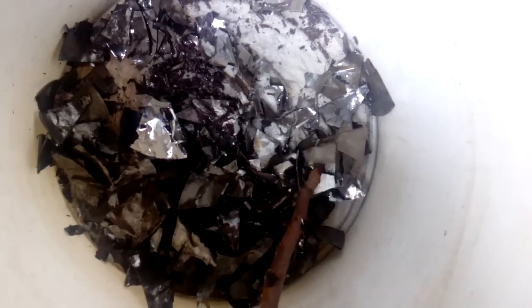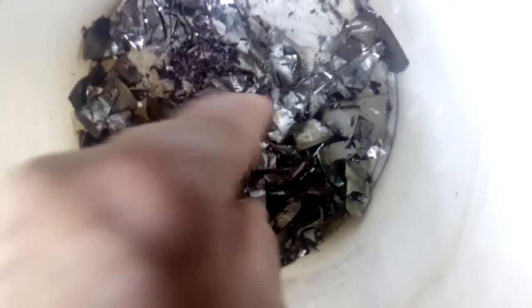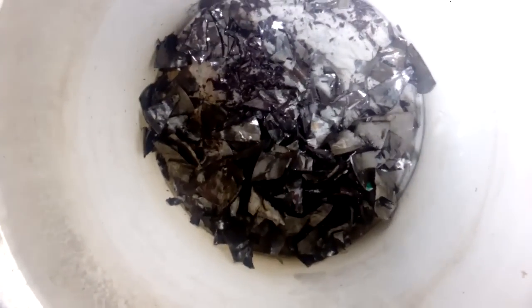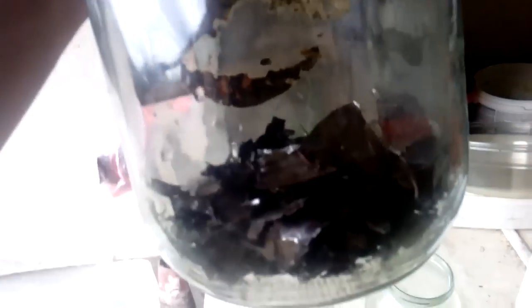I must say that I needed two and a half liters of HCl to dissolve all that aluminum, because it was a very fat, heavy plate. And see that — it's only foils remaining. I already rinsed them with water so I can touch them with a bare hand. Look at that — it's just foils, like zeroed foils. So what we do next: we remove them into a jar and dissolve them in aqua regia.